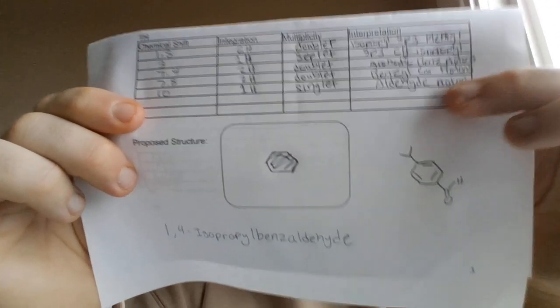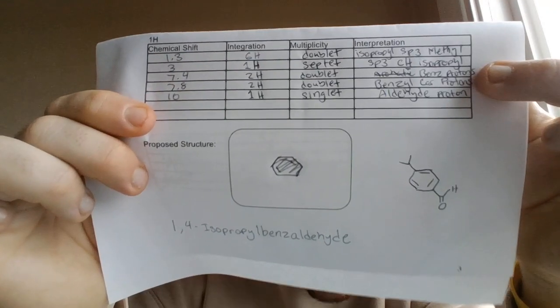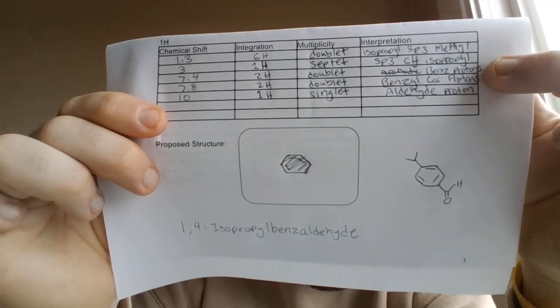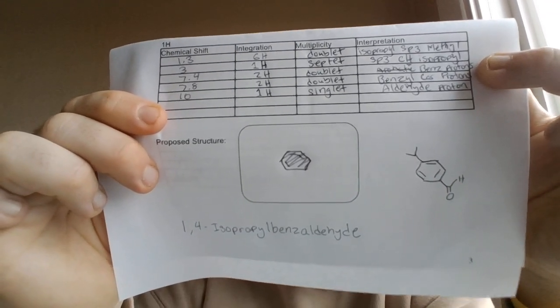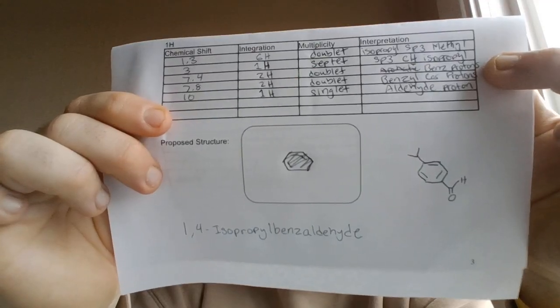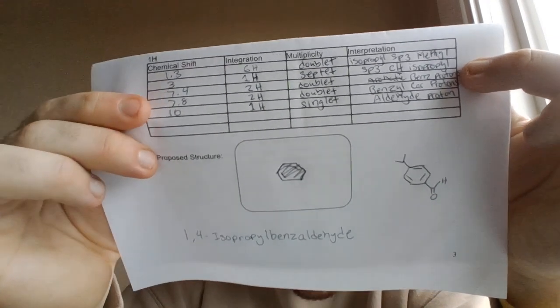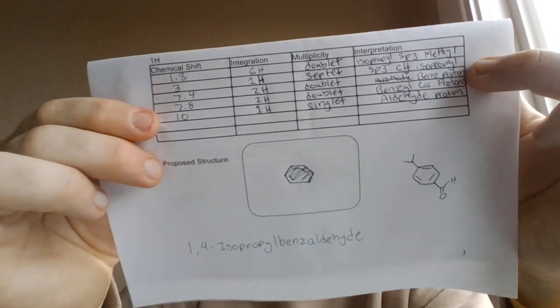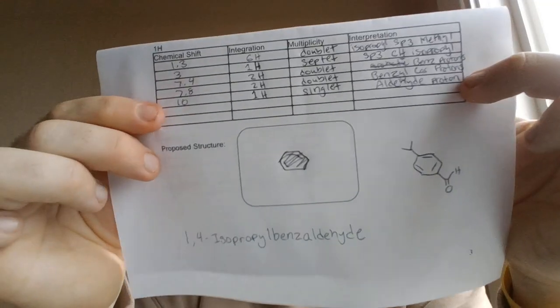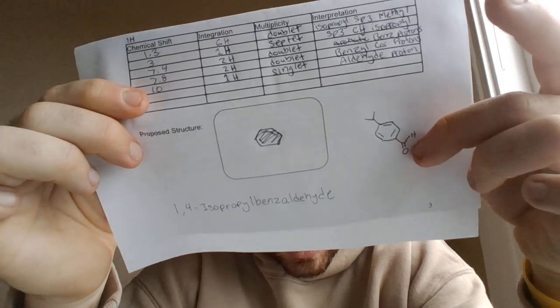And then going to the benzene ring right here, we have two protons coming off of that. So we have two inputs there, both doublets because they're only right next to each other, and they have an integration of 2 as well. N plus 1 gives itself 1, so we are at doublet, and that's in between 7.4 and 7.8. That's where they show up. And then finally, the proton on the aldehyde group, the lone proton, the singlet with an integration of 1, this lone guy over here coming out at 10, telling us that that's an aldehyde group.